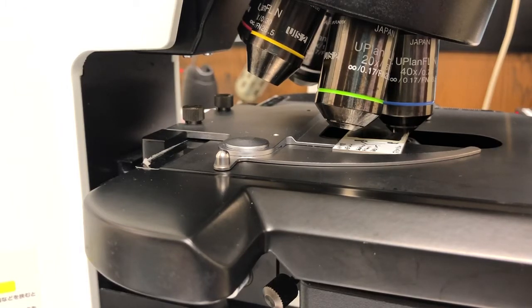So that's the case right now. I just looked at it before I started this video and we have something in the field of view. So now what? Now we need to apply oil to the sample because the oil objectives require oil to work properly.